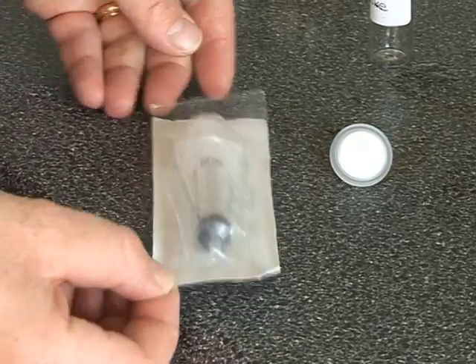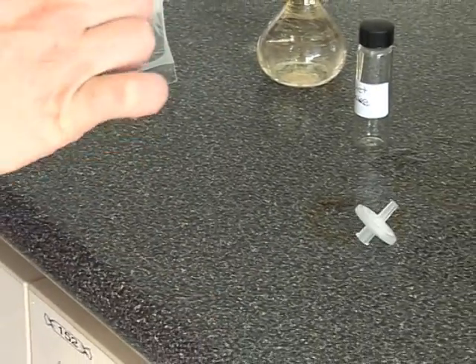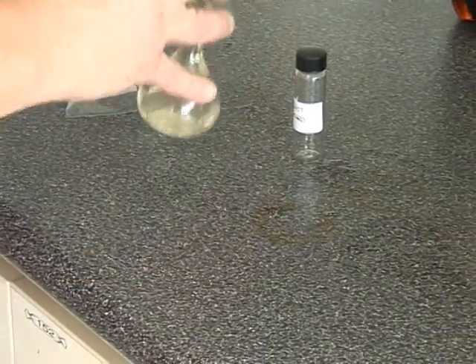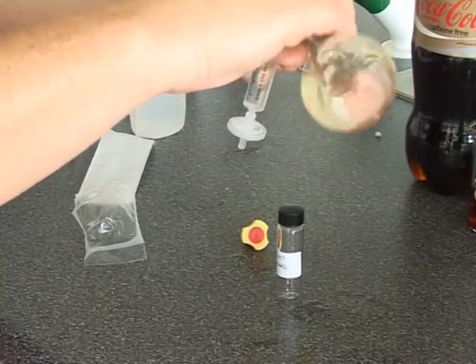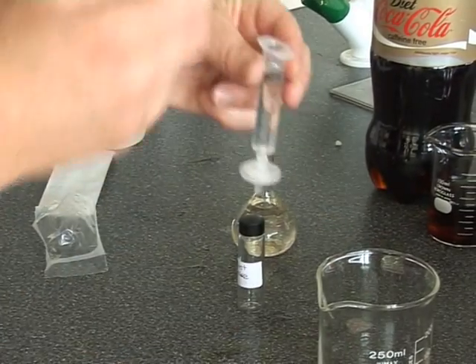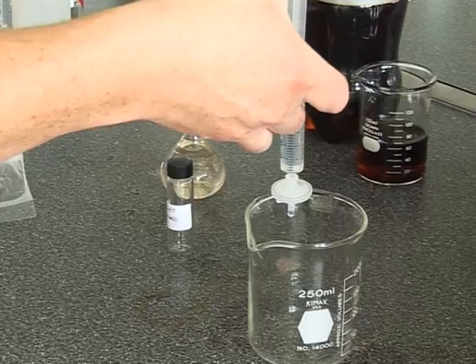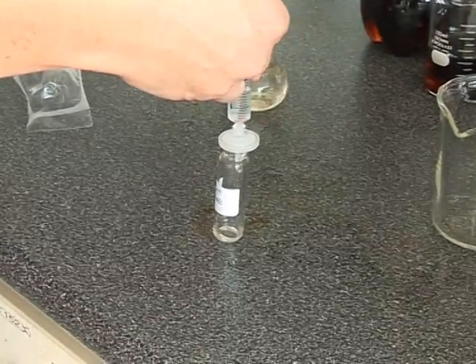Prior to analysing the samples on the HPLC, you're required to filter the samples using a syringe and membrane. Remove the filter from the syringe and pull out the plunger. Replace the filter on the end of the syringe. Pour approximately 5 millilitres of the sample into the syringe. Replace the plunger into the syringe and push the plunger down slowly so that the sample passes through the membrane filter. Discard the first few mils of the eluent and then collect the rest of the eluent in a sample bottle. Make sure you label the bottles with the corresponding sample.